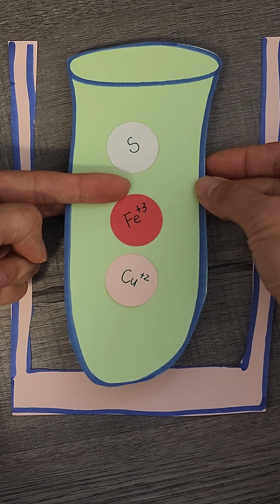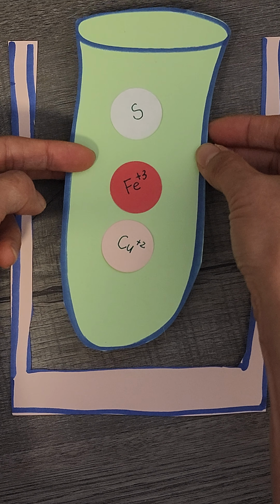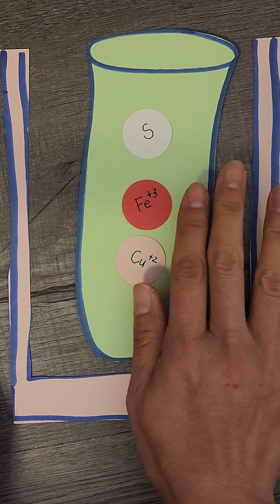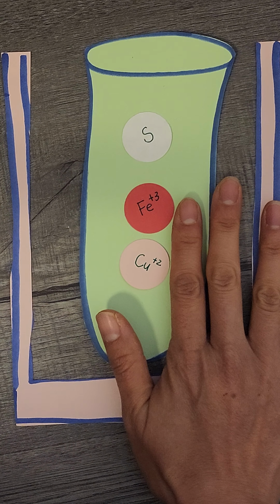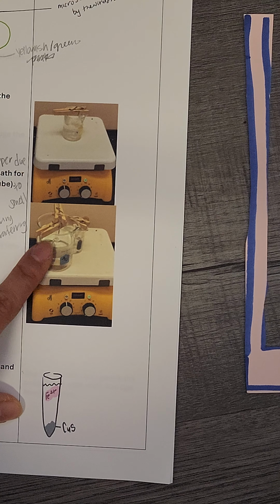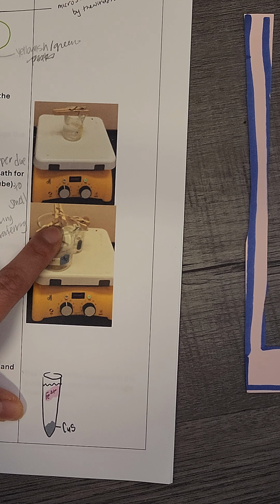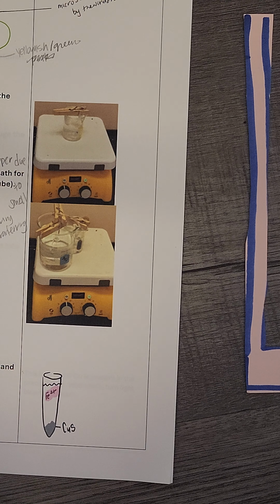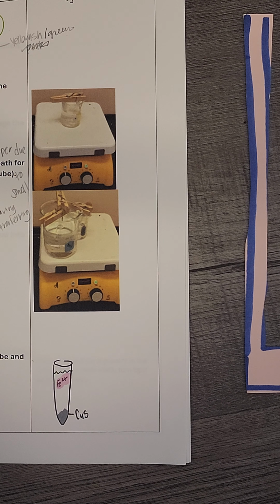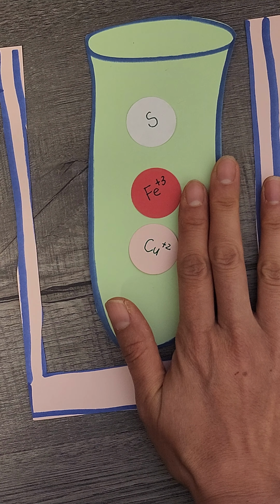You're going to use a clothespin to clip the test tube. This is so that when it heats up, it doesn't move around, or else sometimes the water gets in here. So you do have to clothespin it. Here's another image to show you the clothespin. Here's the beaker, the test tube, and the clothespin holding the test tube, and that's the hot plate. You don't want to boil it, but you definitely want to have it nice and warm.